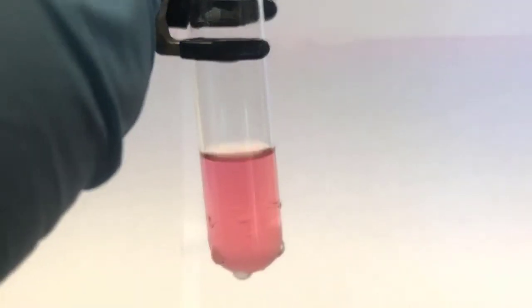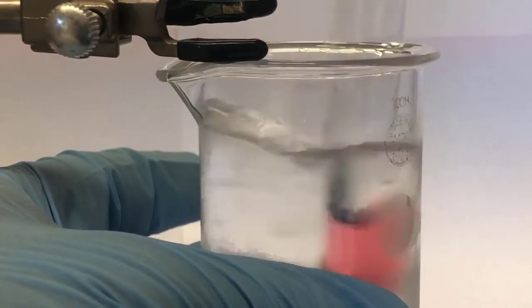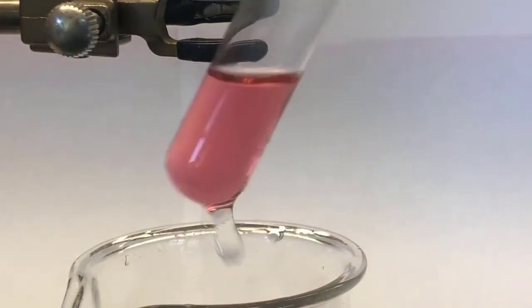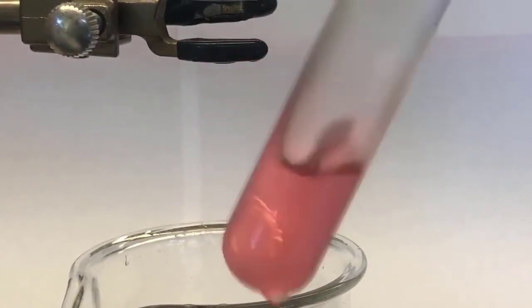So that was on time lapse. I don't know if you can see it or not. Let's go ahead and stick it in here, get it really cold. It's kind of a cool bath, not a really ice bath. I might try something a little colder here. But there we go. That's what it looks like now. All right, you can go back in the video and compare to what it looked like before.